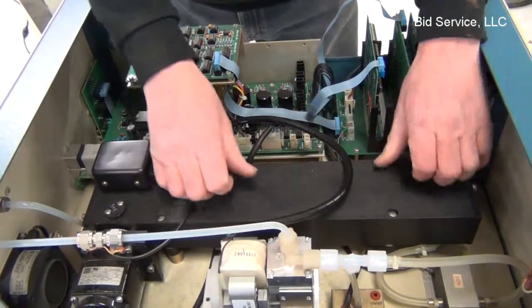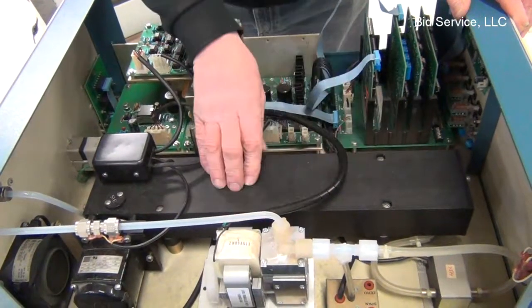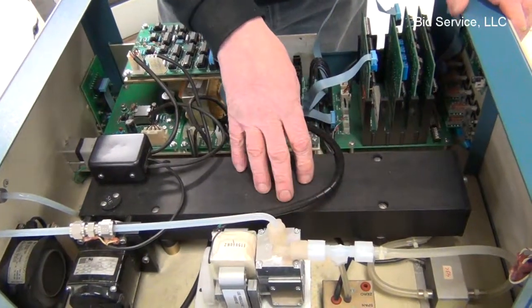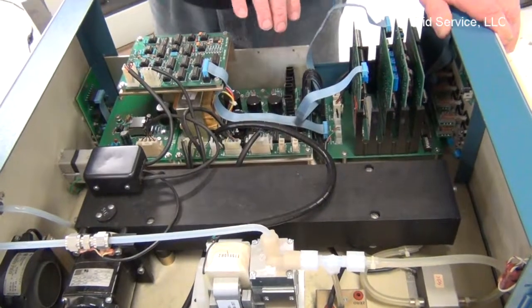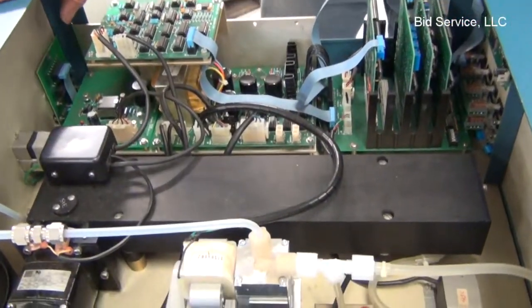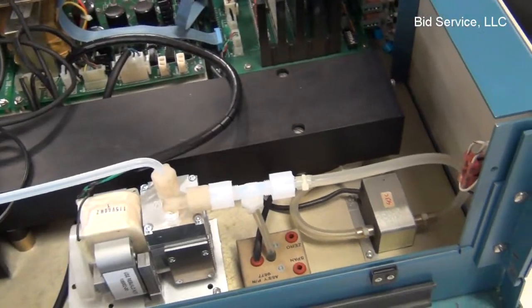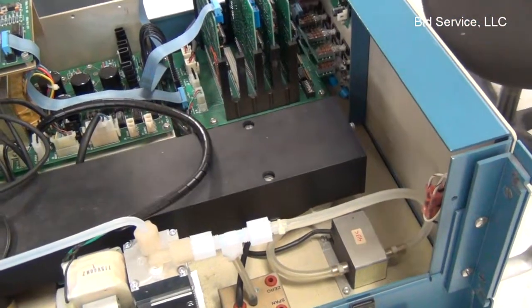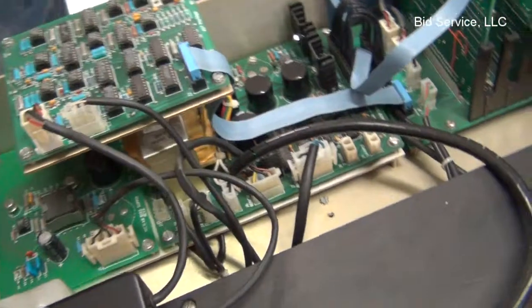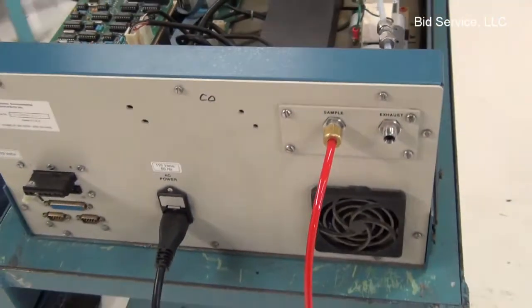Once the level of CO is detected, the information is sent over to the electronics, processed through the motherboard, and then displayed in real-time on the front, or it can be communicated through a series of RS-232 ports and computer ports in the back.